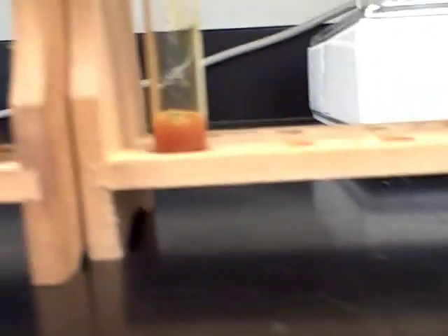The egg white might be kind of tough to see, so I'll swirl it around a little bit. We're looking for black in the egg white. Then gelatin powder, and then egg white.